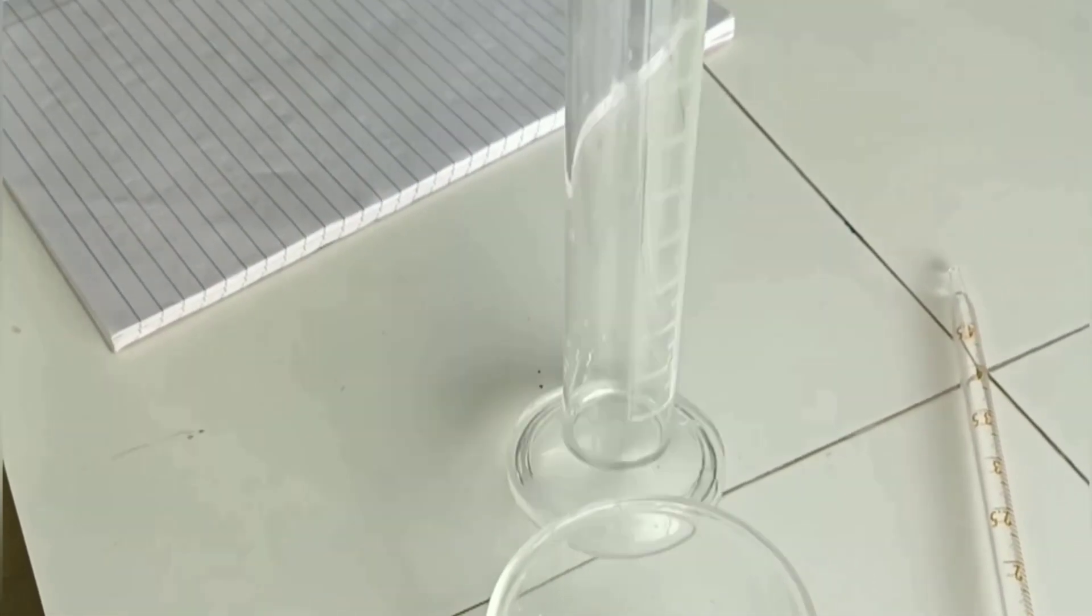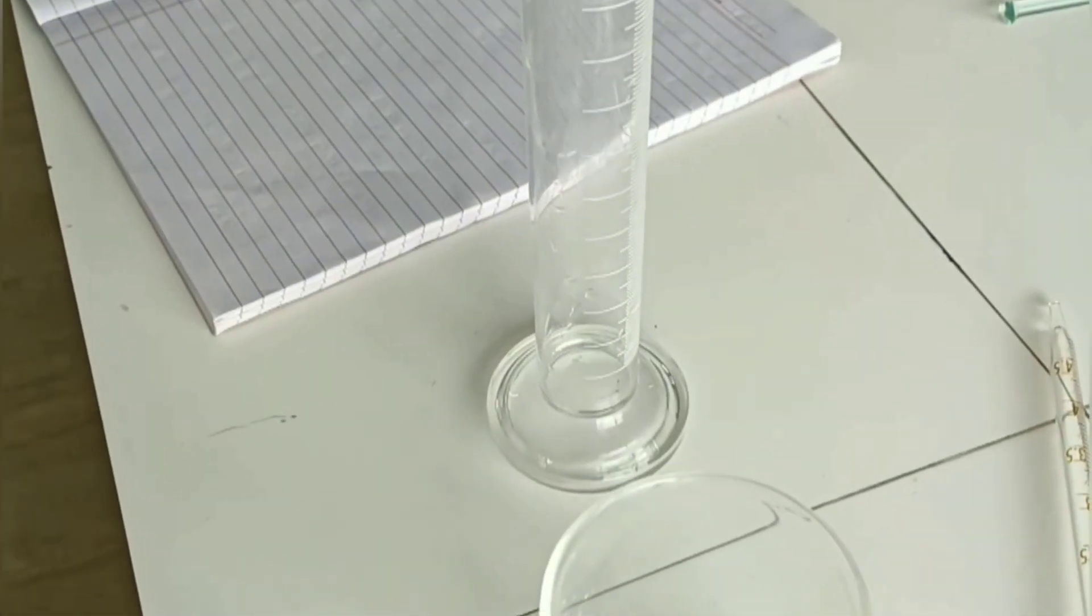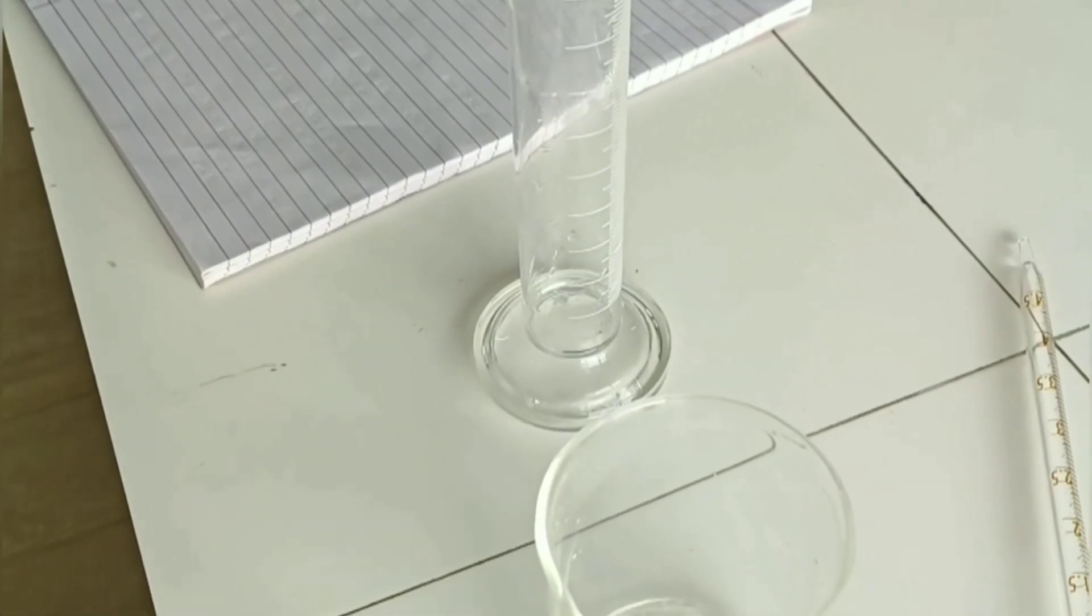The apparatus required for this practical are measuring cylinder, glass beaker and a pipette. And the chemicals required are phenol glycerin, amaranth solution and distilled water.